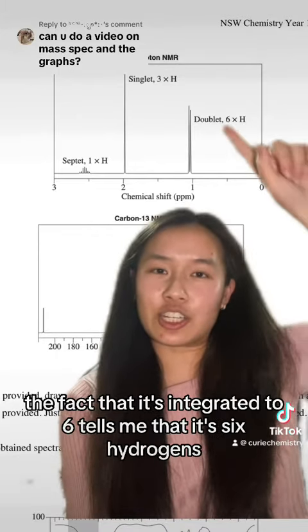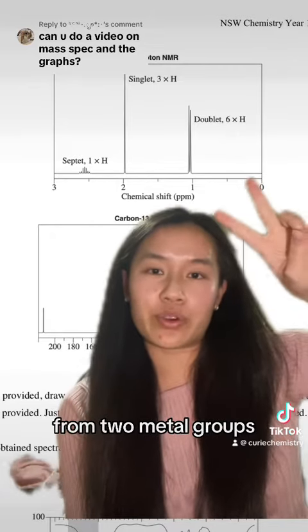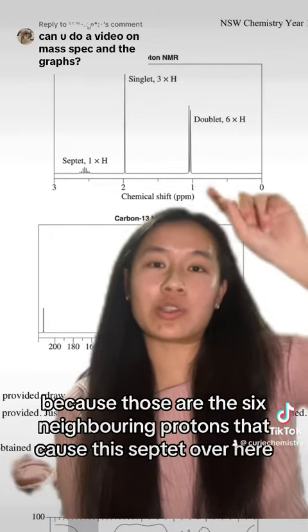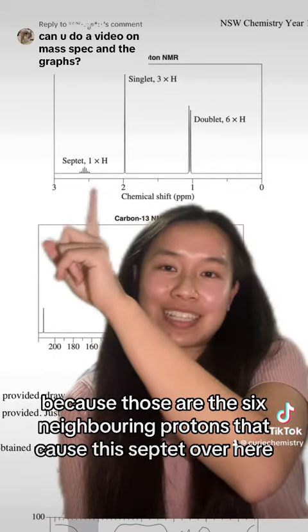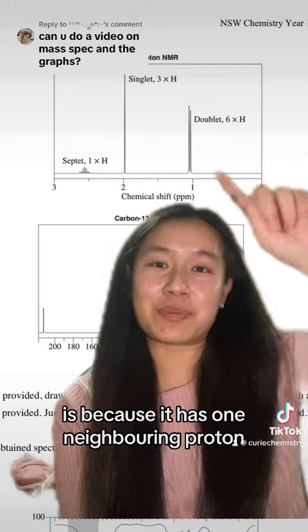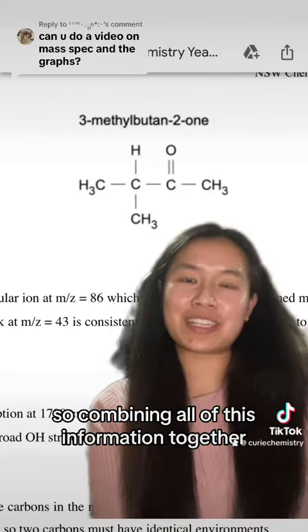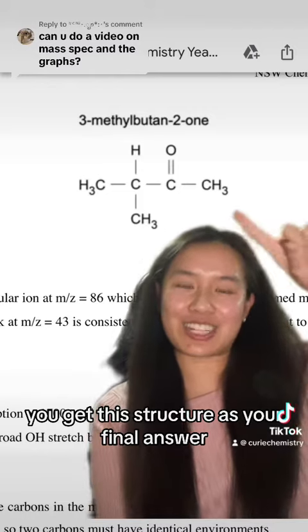The fact that it's integrated to 6 tells me that it's 6 hydrogens from 2 methyl groups, which works perfectly well because those are the 6 neighboring protons that cause this septet over here. And the reason why it's split into a doublet is because it has 1 neighboring proton, which caused this signal. So combining all of this information together, you get this structure as your final answer.